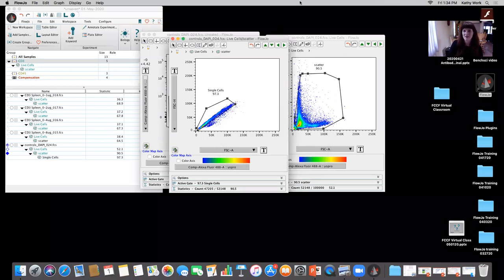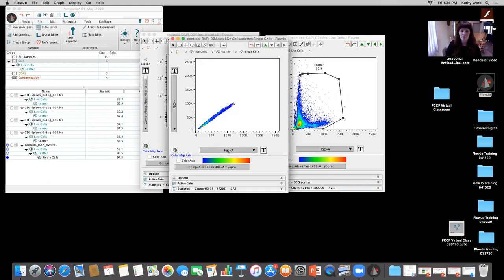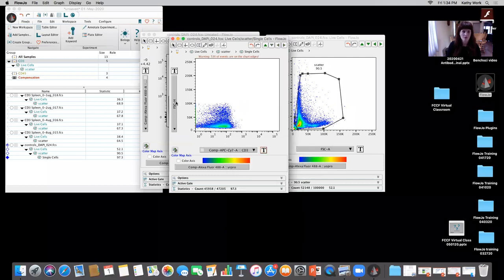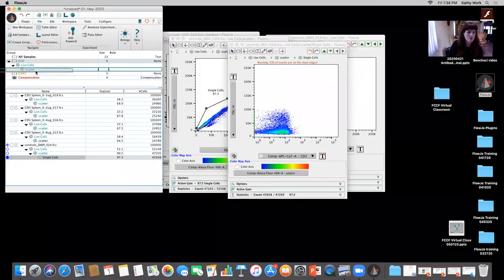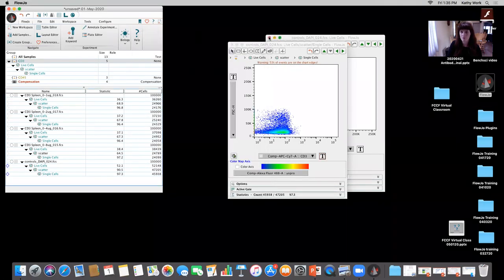See, we have a good discussion going on up there, so that's exciting. And then from there, I'm going to look at the CD3 antibody. Okay, so this is the control. And because I have a single cell gate, I'm going to drag that up, give that a quick check. Everything's good.